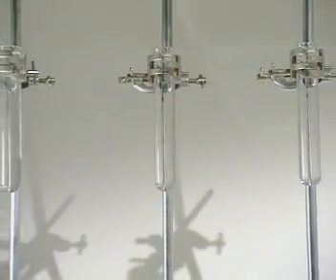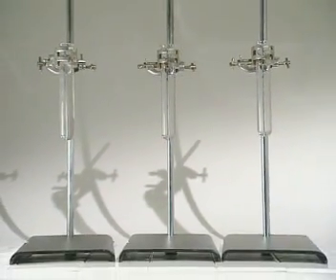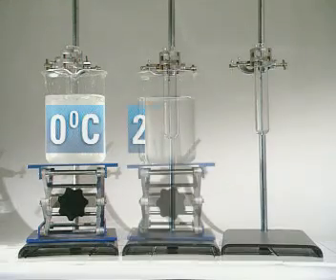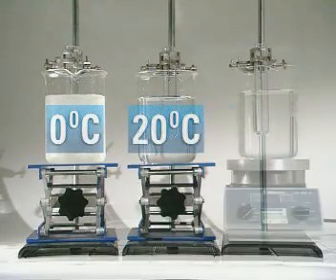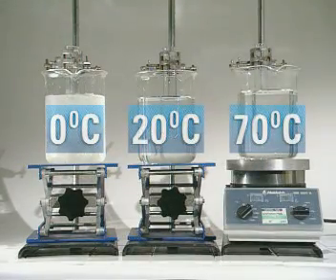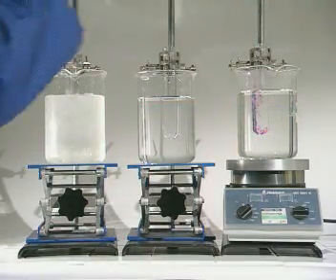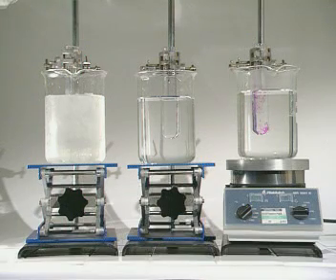These three tubes containing water are immersed in baths at different temperatures: 0, 20, and 70 degrees Celsius. A crystal of potassium permanganate is placed in each.